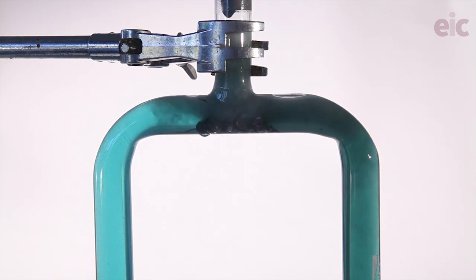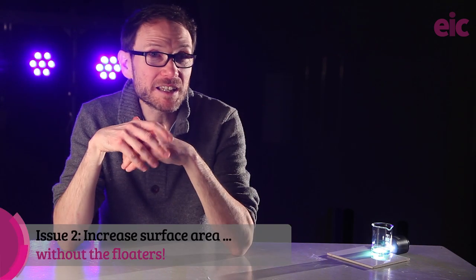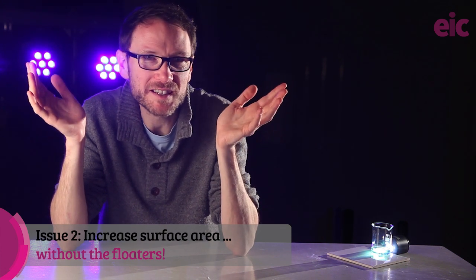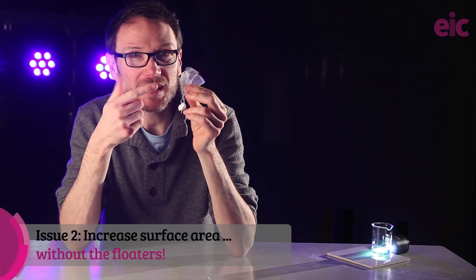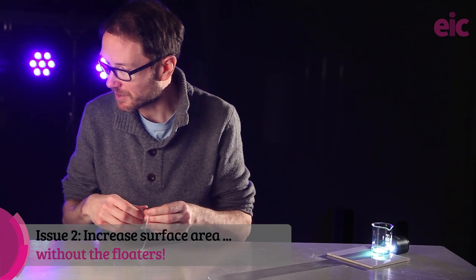My first trial was with the zinc up top, using a candle to initiate convection on the bottom corner and drive the solution past, as well as gently warming. Still took an hour. And it did need at the end some encouragement from zinc powder to get over the finish line significantly into the vanadium 2 area. Clearly, powder is helpful, but how to stop it making a bubbly mess and floating around in bits everywhere? So then I thought I might be able to use a tea bag lowered into the solution containing some zinc powder. Let's give it a try.